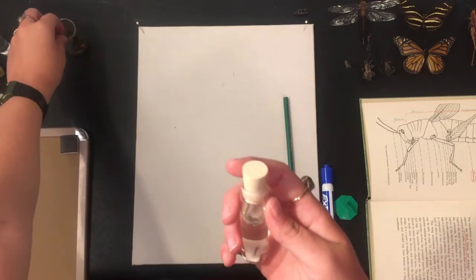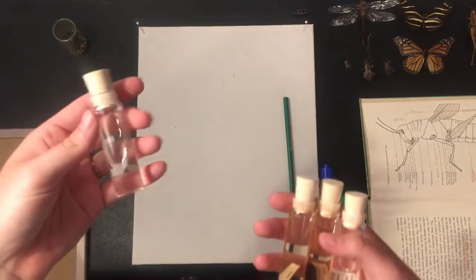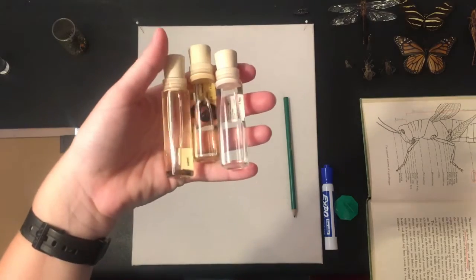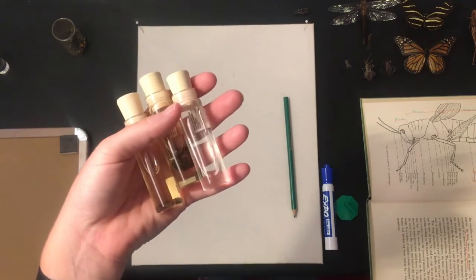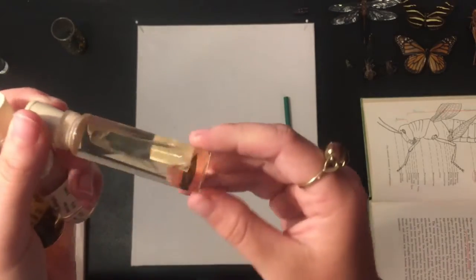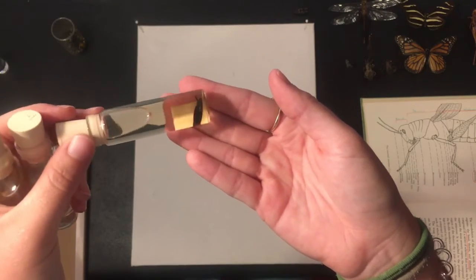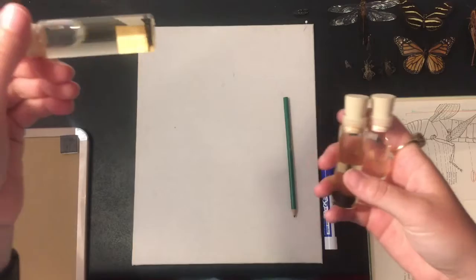I wanted to show you guys this vial. I did this in college, so I have a couple already in vials. Here's one with just alcohol, and right here I have three different ones in vials. What you would put in vials: all immature insects — anybody that's not an adult — silverfish, springtails, termites, lice, thrips, fleas, those types of things. This one right here is a water beetle. We're also going to pin another beetle, because not all of them get put into vials.